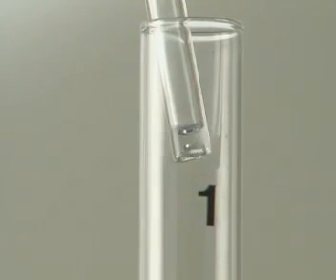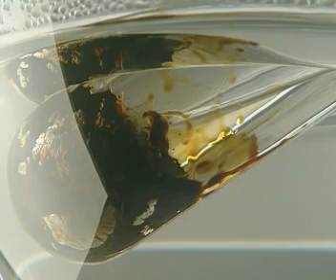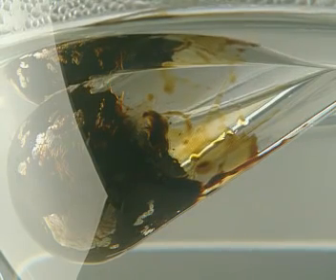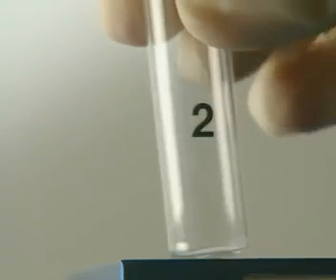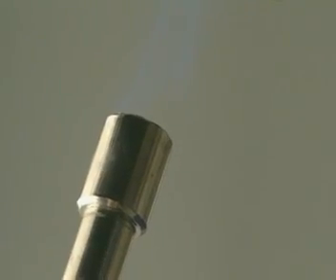The temperature stays at around 40 until all the hydrocarbons with this boiling point have vaporised. The hydrocarbons left behind aren't hot enough to vaporise. Their boiling points must be higher. Once the first fraction has been collected, it's safe to start heating with a Bunsen.